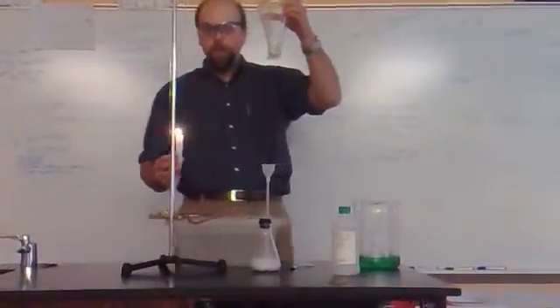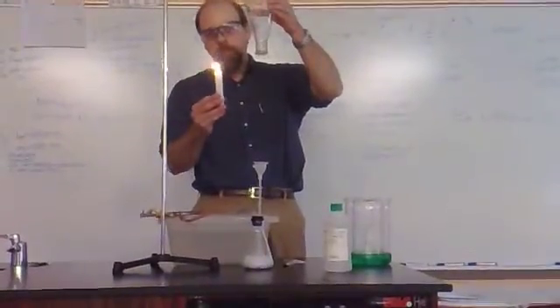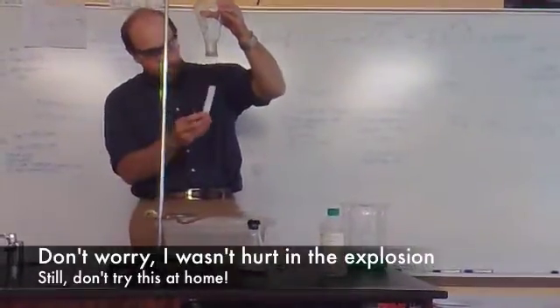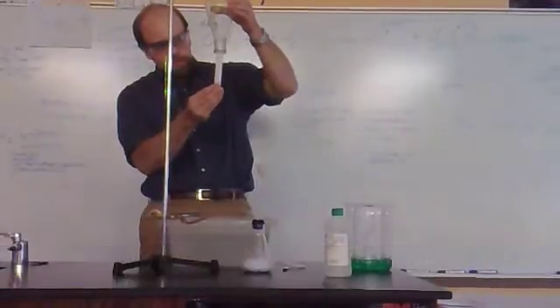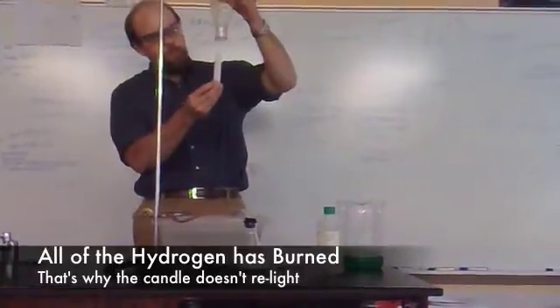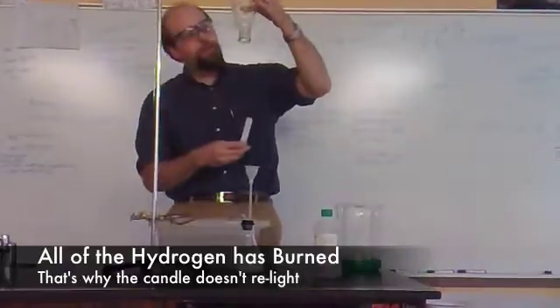Okay, so now we have a full flask of hydrogen. We've turned out the light so that we can see what's going on a little better. I have a lit candle here. Whew, that was exciting. That wasn't supposed to happen that way. But I bet you we still have a flame here. No? Why did this work so perfectly when I was not videotaping it? Obviously, we're going to kill this one. Oh, God.